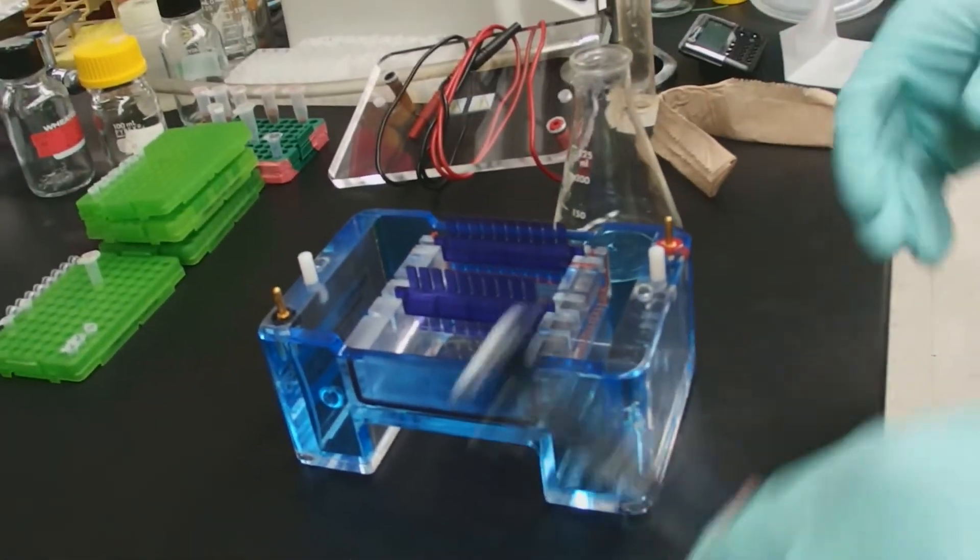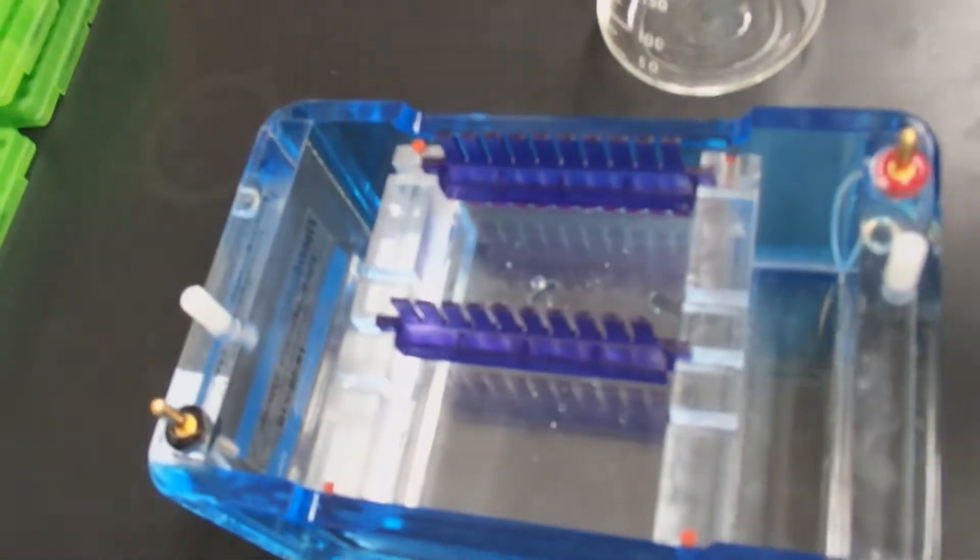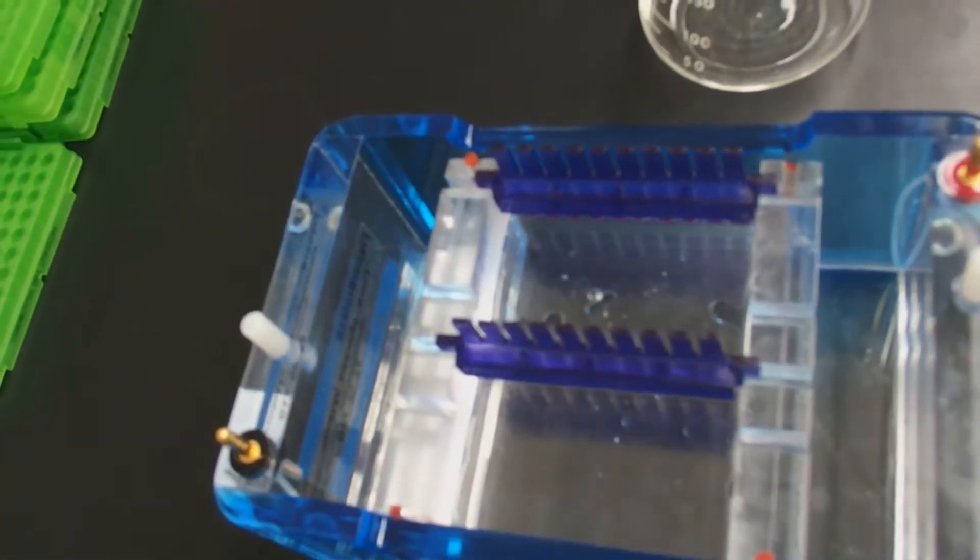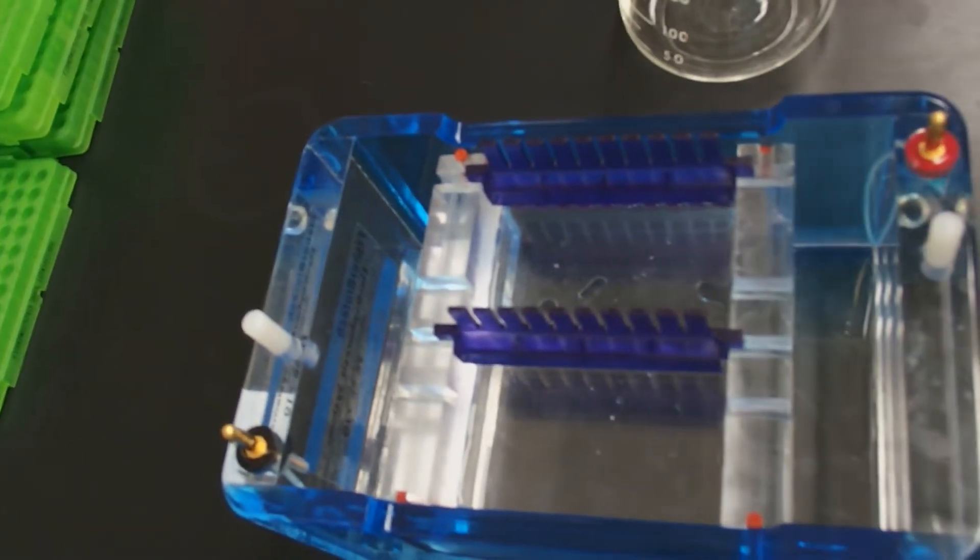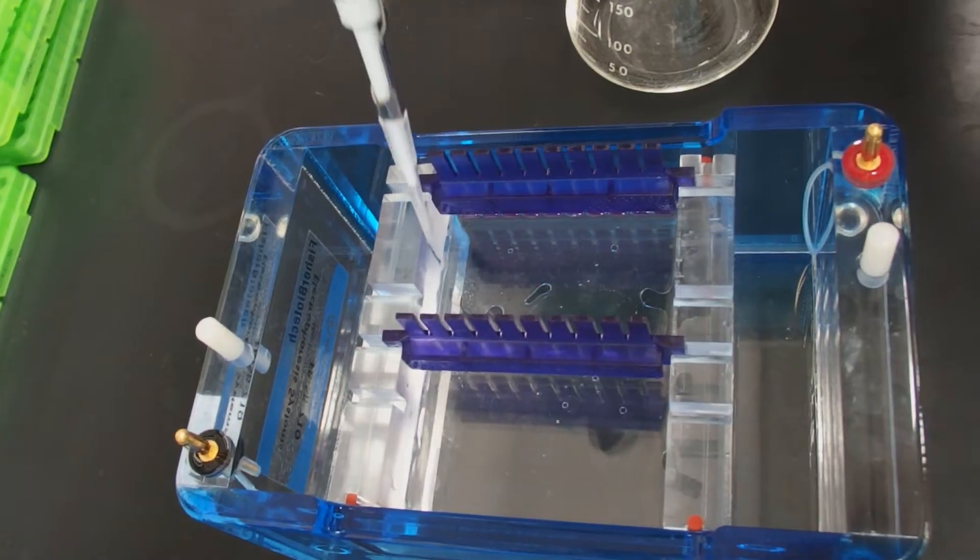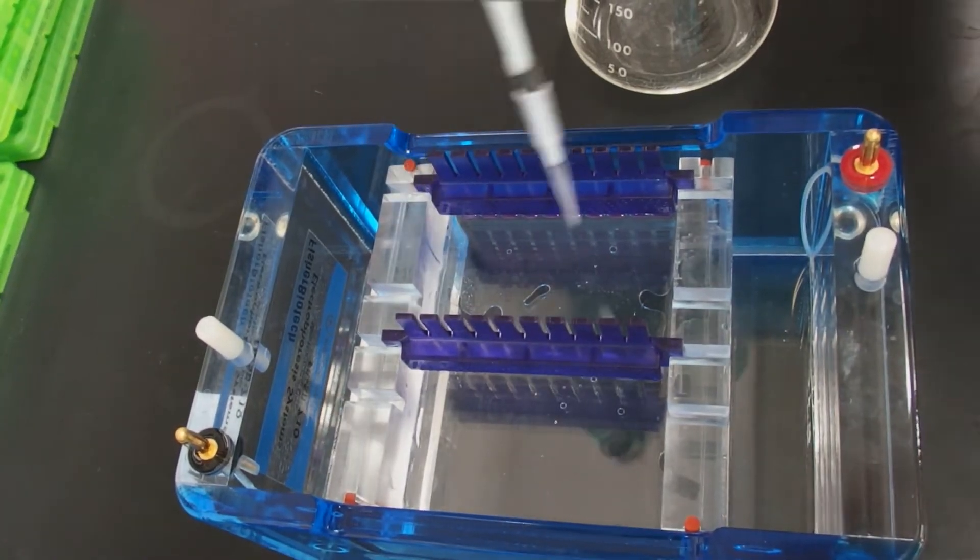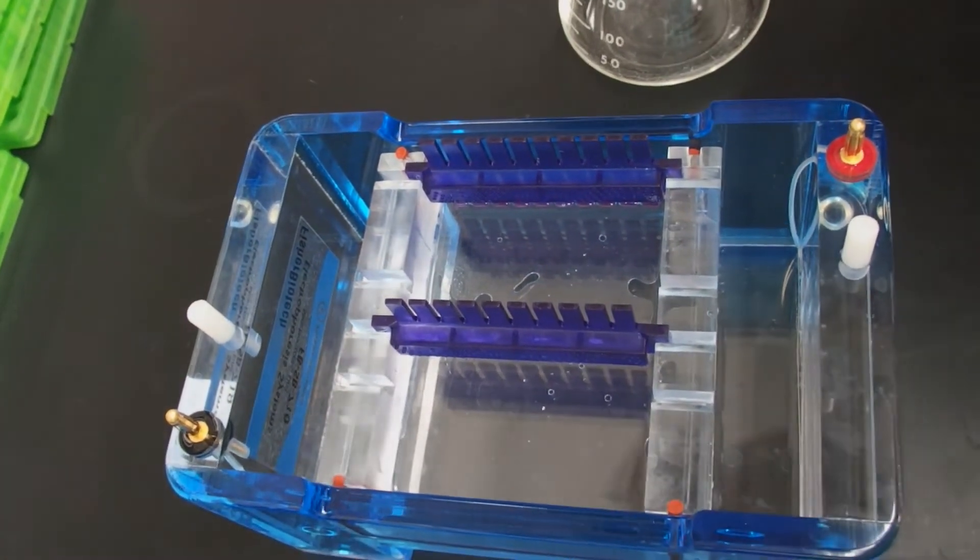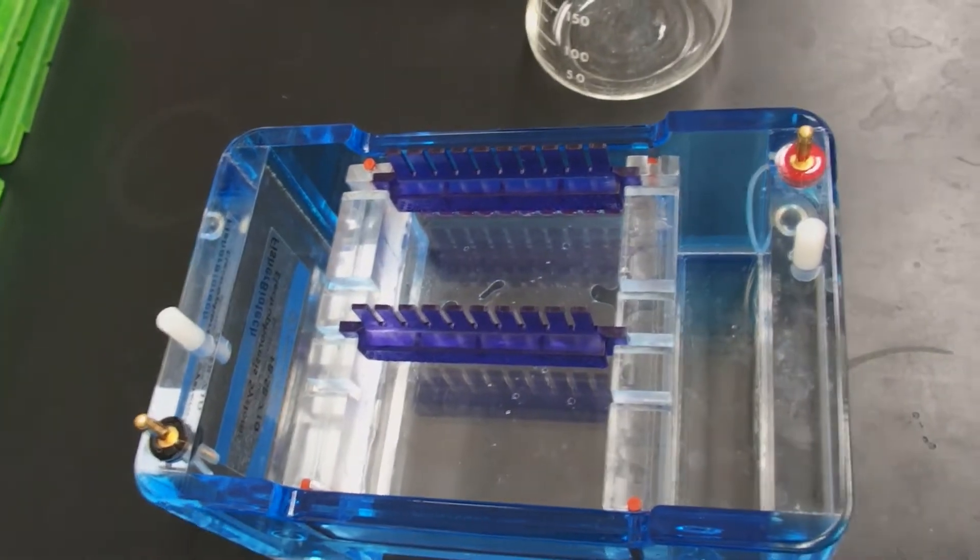And if there are some bubbles, you see we have a bubble right here, we need to move that bubble out of the way. The way that you would do this is take this pipette—well it popped—but we have another tiny bubble here. I'm just going to take this and pop it or move it to the side. Anyway, we're going to let that solidify. Come back when it's solidified.